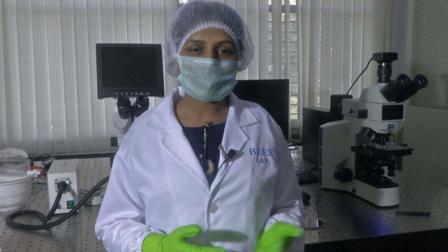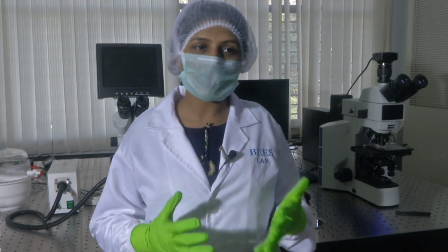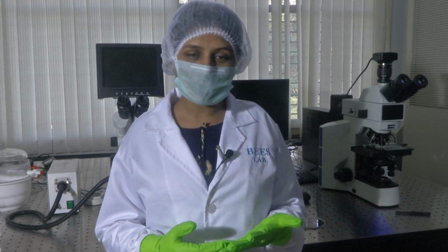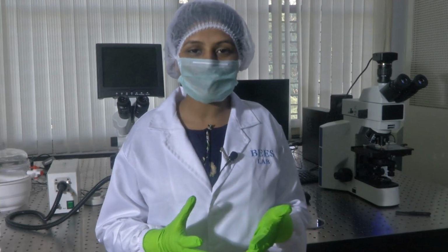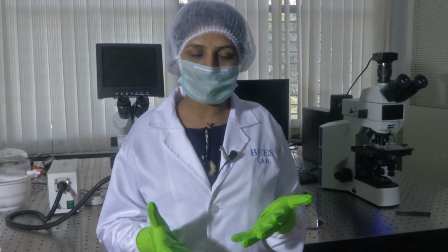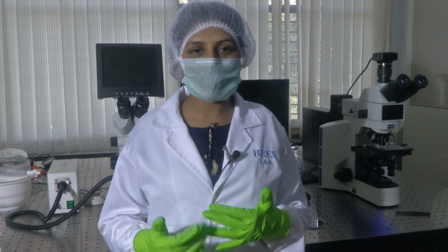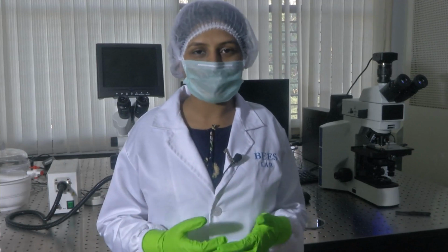There are other methods, like the electron based ones, which are highly sophisticated and not really required for us. So now that we have these three devices, let us get into the details of these devices, the mechanisms, how you operate them, and how the features could be deciphered using these microscopes. So let us get hands-on with these devices.